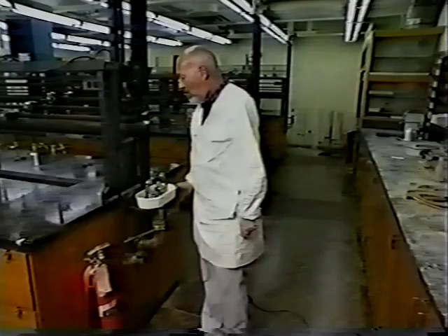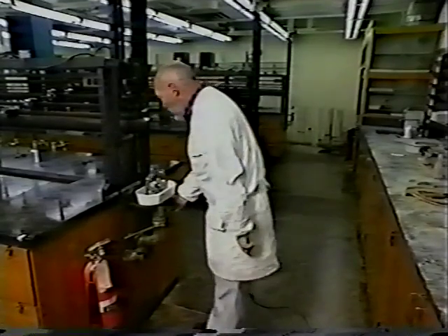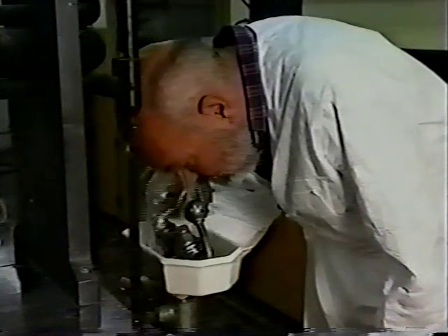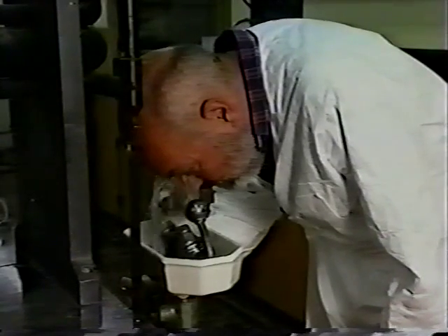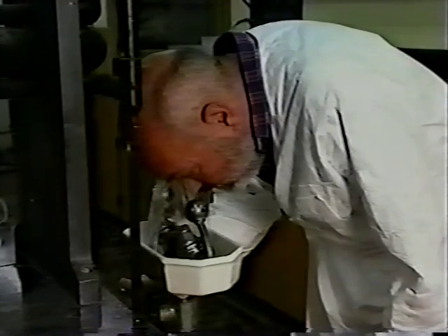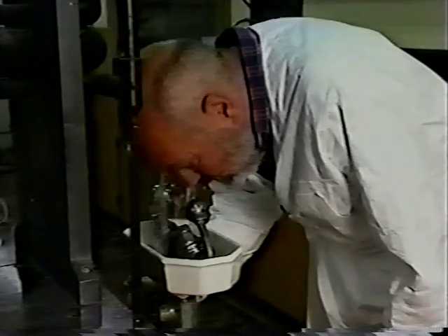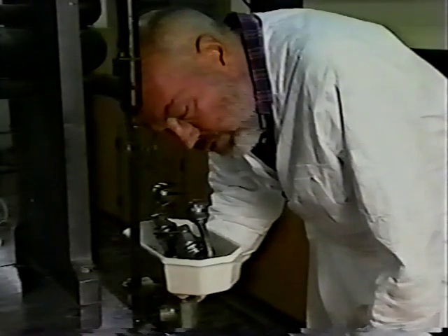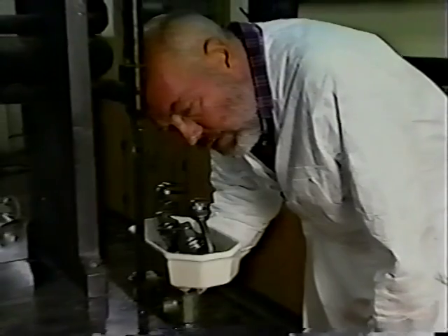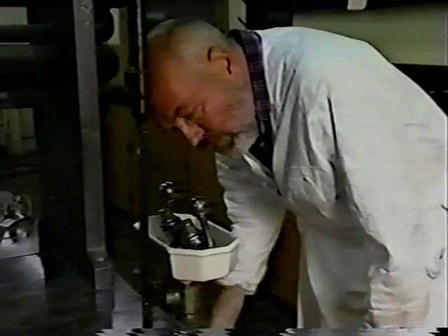Start washing your eyes under the eye fountain as quickly as possible. Washing should be continued for at least 10 minutes.